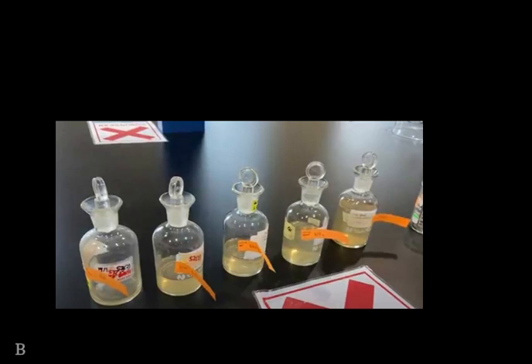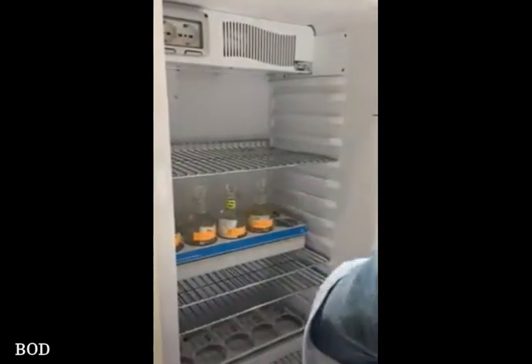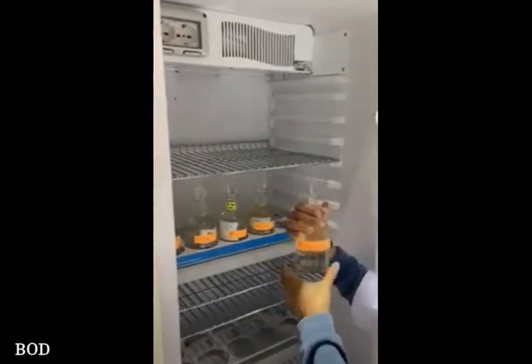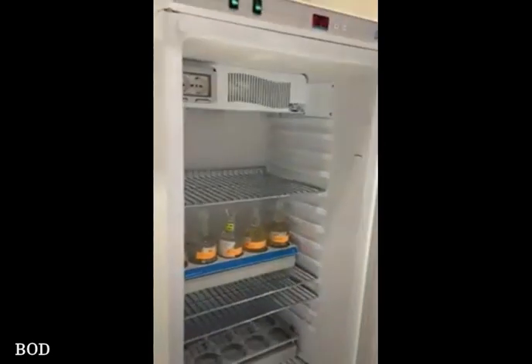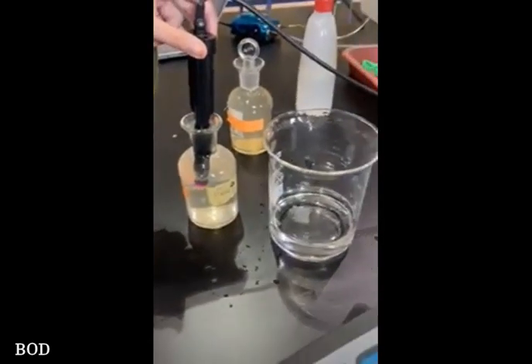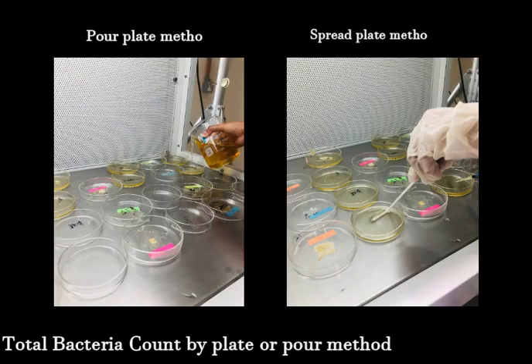6 units of 300 ml BOD bottles were labeled. Each bottle was partially filled with dilution water and the sample size was added. 1 bottle was filled completely with distilled water as the blank sample. The remaining BOD bottles were placed in the incubator at 20 degrees Celsius and incubated for 5 days. The initial dissolved oxygen and final dissolved oxygen were recorded. Then, the total bacteria count was conducted with the plate or pour method.